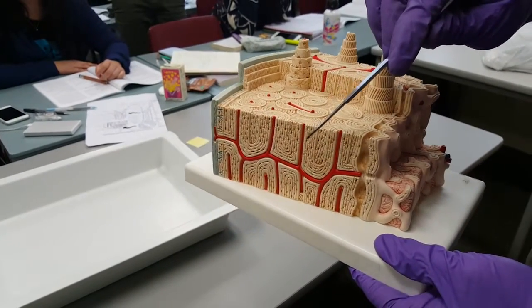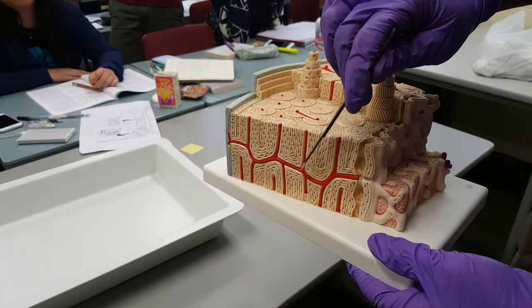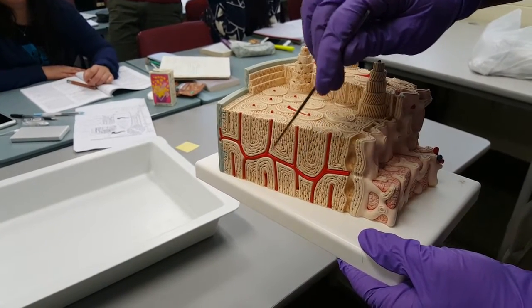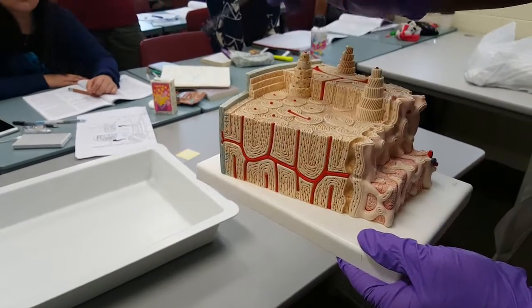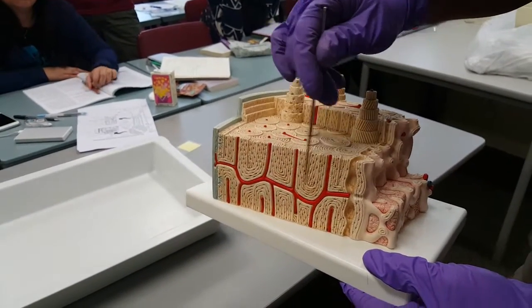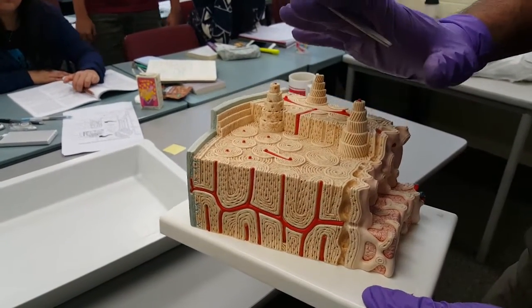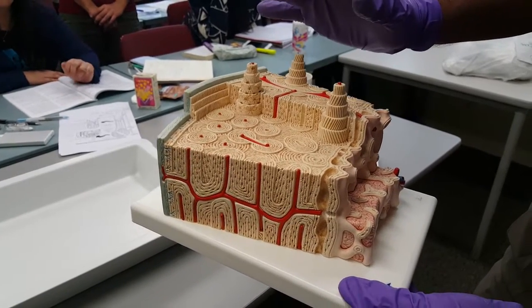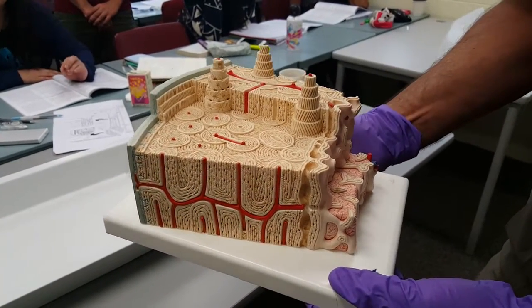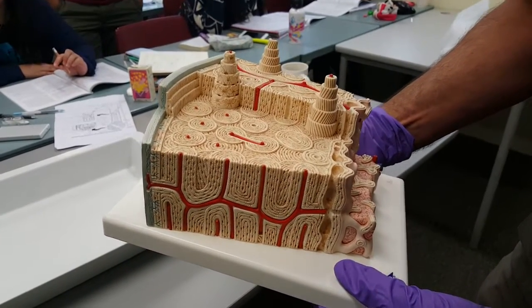And then we also have the arteries joining from one osteon, one central canal, to the next central canal here. You can see them running in these transverse canals. You can see that quite clearly here. So these vessels are all linked up together. So bone has a rich blood supply. It is not a dead, lifeless tissue that some people think that it is. It's a dynamic tissue with a very rich blood supply.